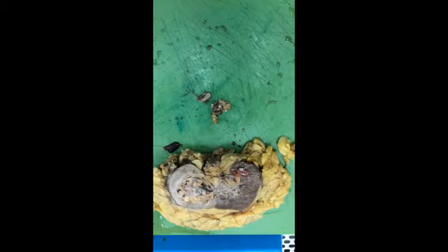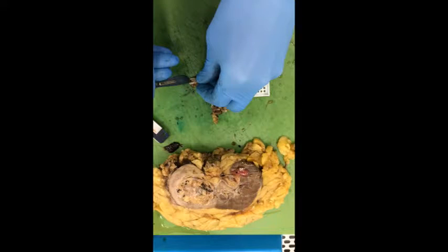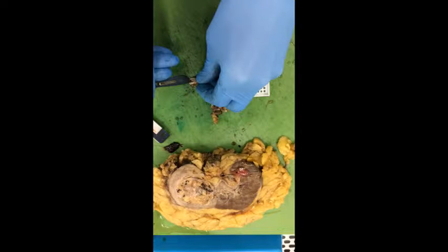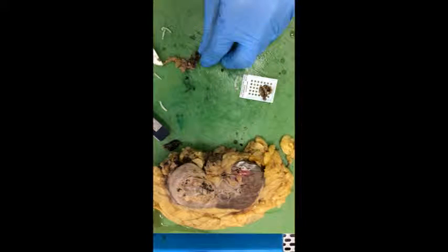When you examine the kidney tumour, make sure you cut at 4, 7, and 10 centimetres. Remove the clips off the renal vessels and place in the cassette.